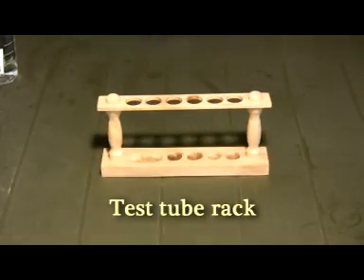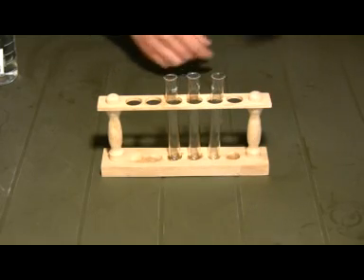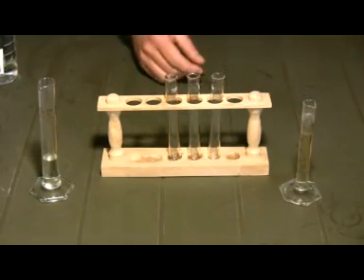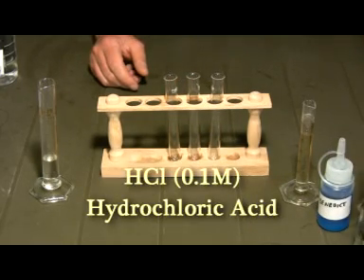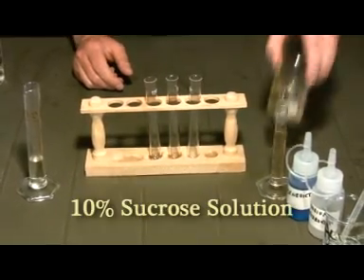You need a test tube rack, three test tubes, some cylinders, Benedict solution, hydrochloric acid, sodium hydroxide, and some sucrose solution.